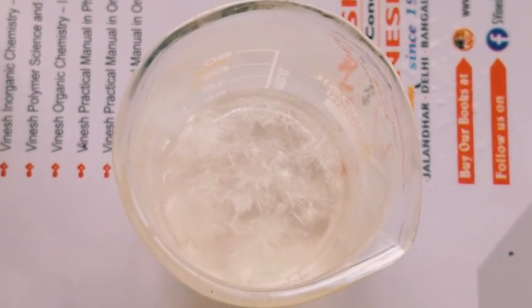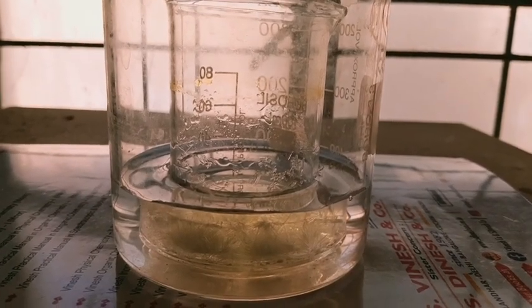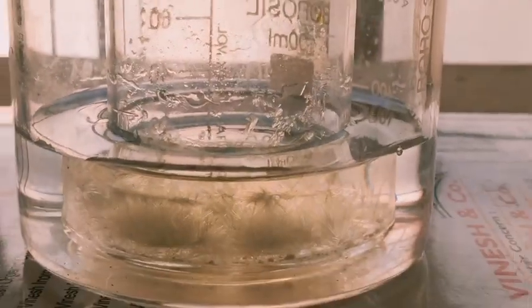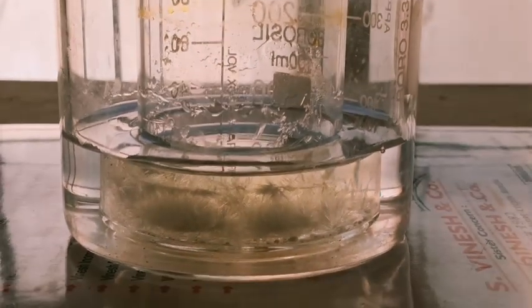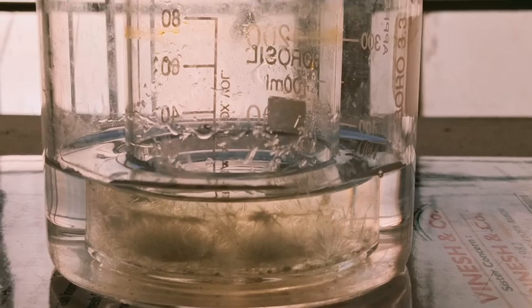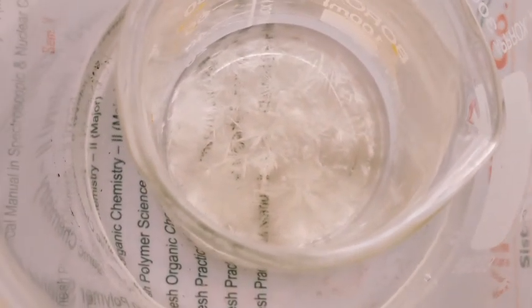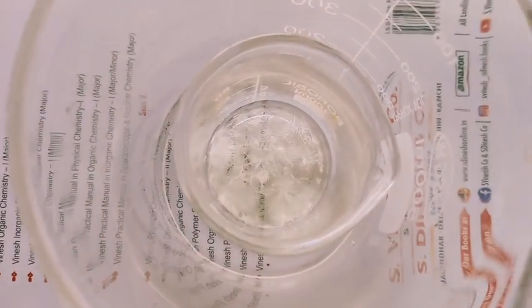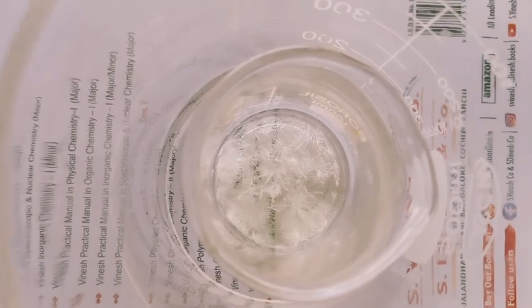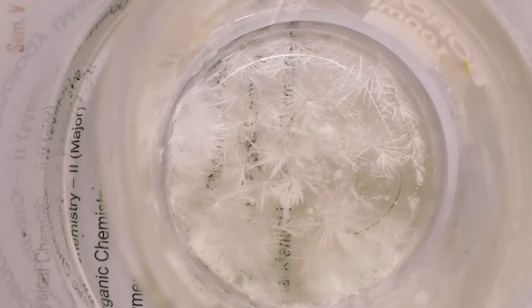You can also use an alternative if in your lab you have a setup like a chamber or any source that can generate ultraviolet light, such as a UV tube. You can keep it under that setup where the ultraviolet light is available, for 2 to 3 days or a minimum of 24 hours. You can see here in this video we have done the same exercise and followed the same procedure which I am discussing here.